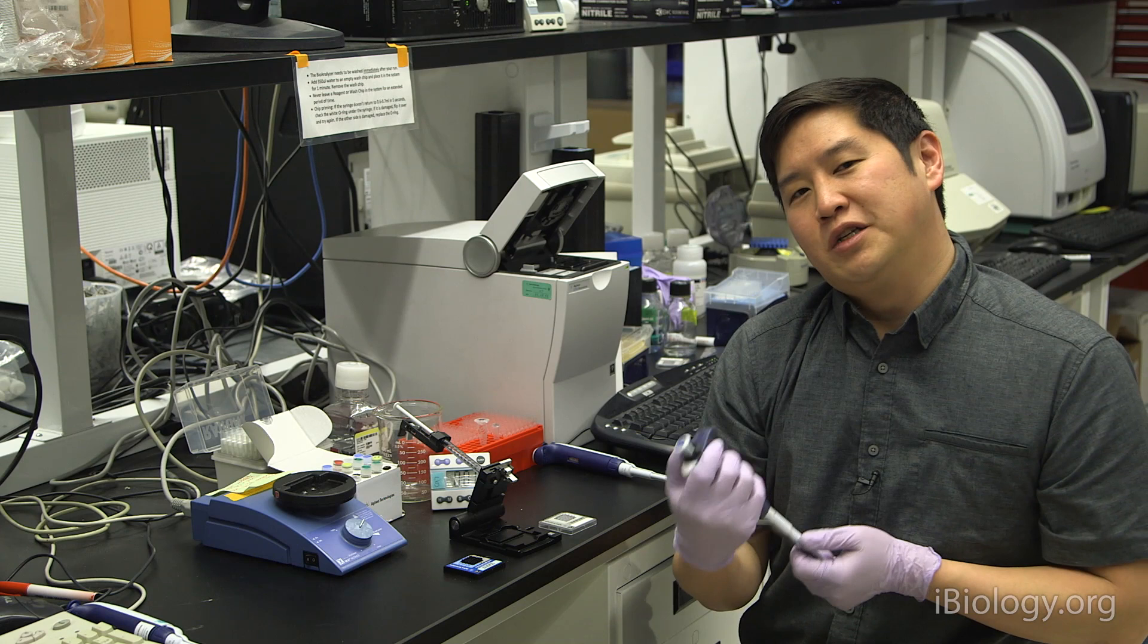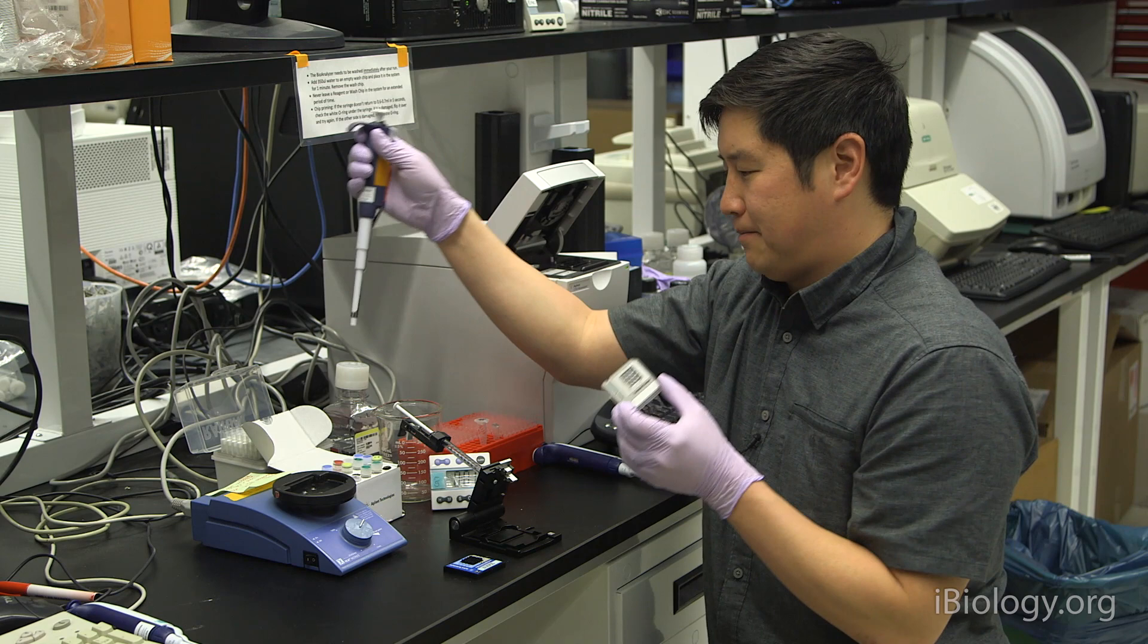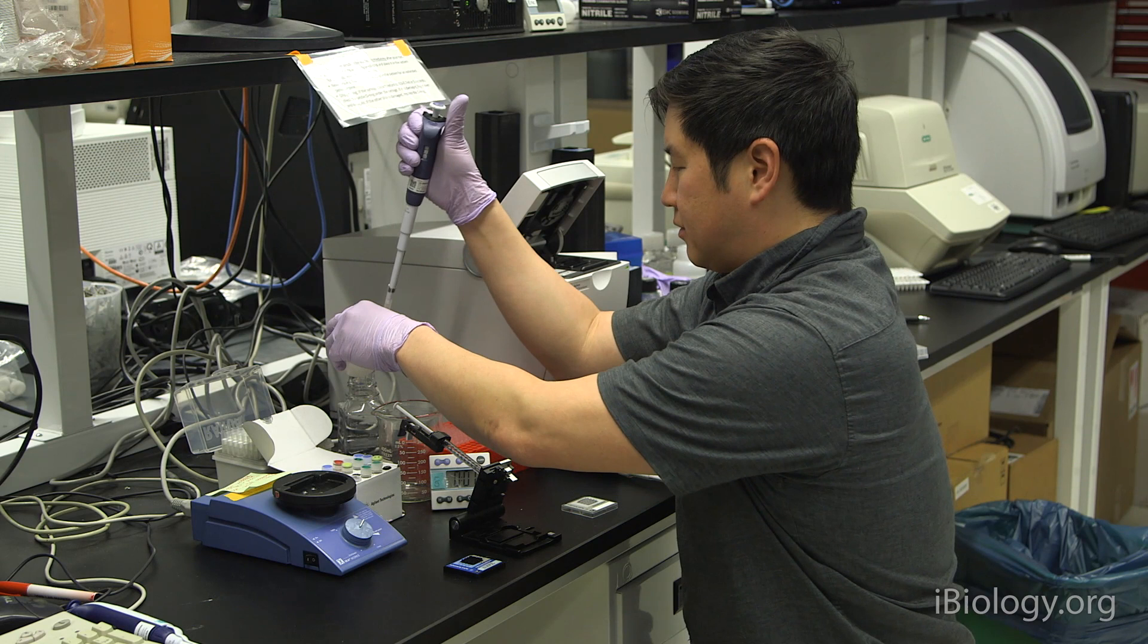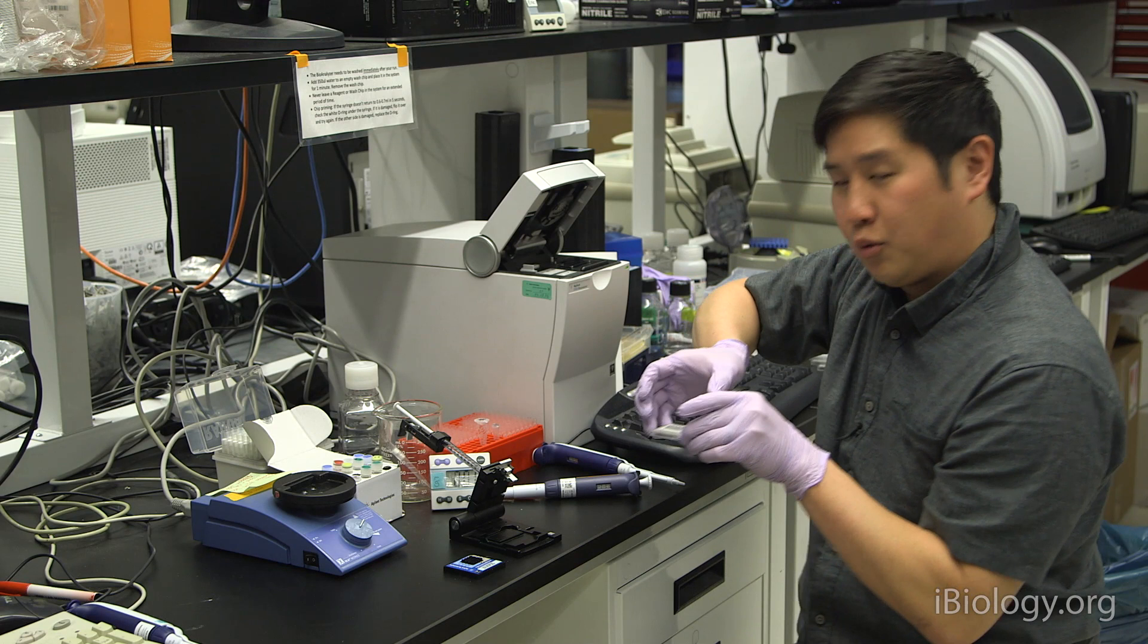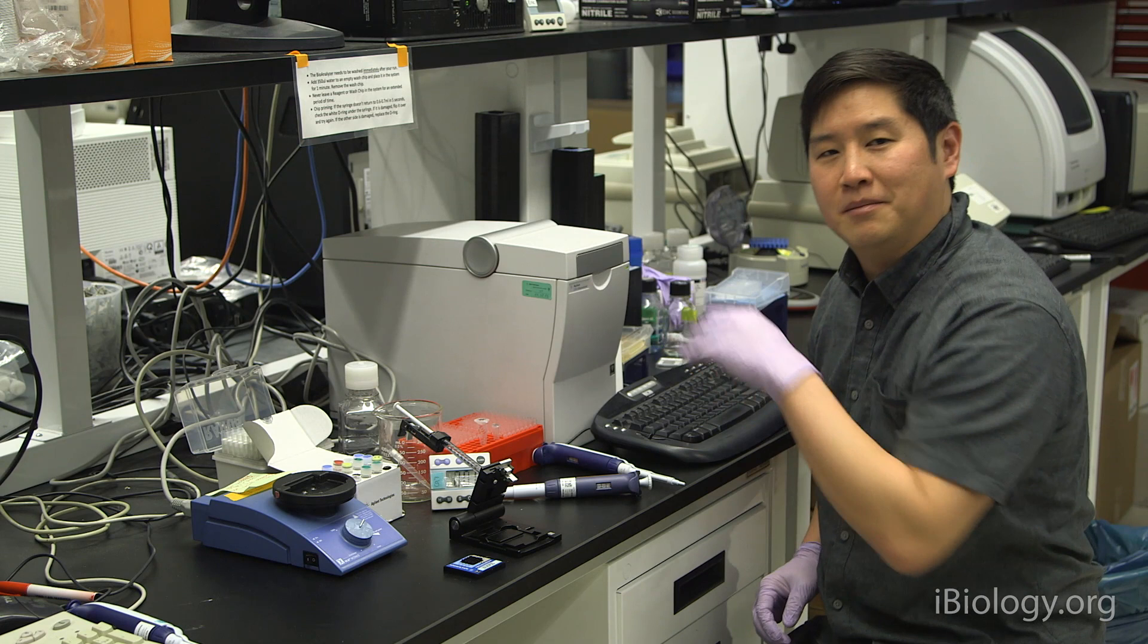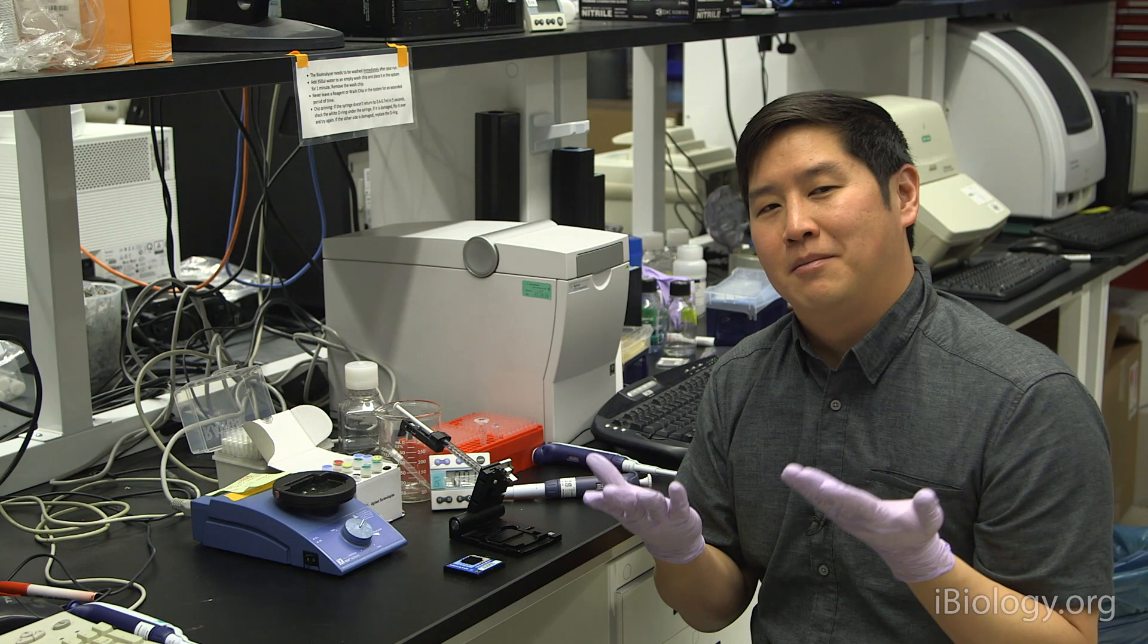The next thing we're going to do is wash the system. To wash the system, you want to use 350 microliters of nuclease-free water and place it into a wash chip. To wash, simply place the wash chip on the chip holder and close the system, and let it sit for about 30 seconds to 1 minute.